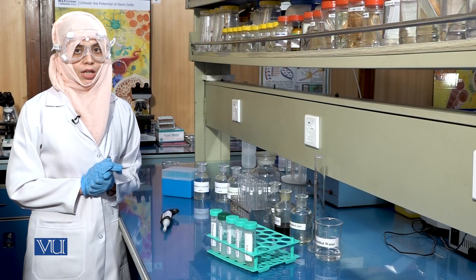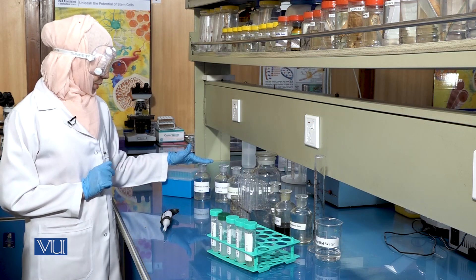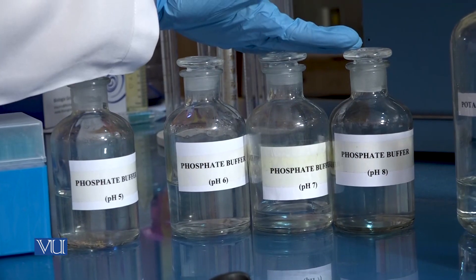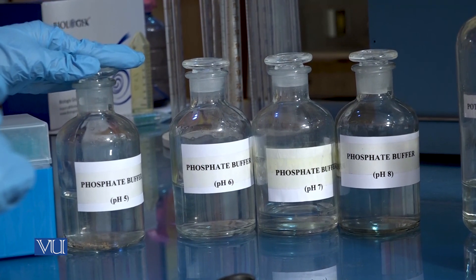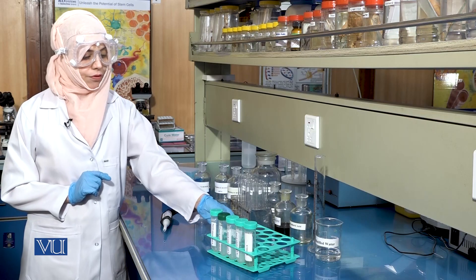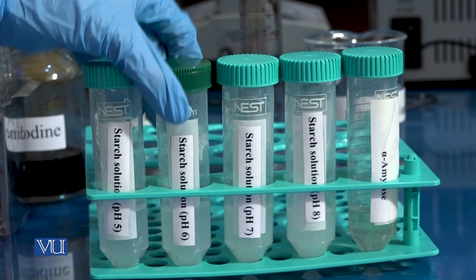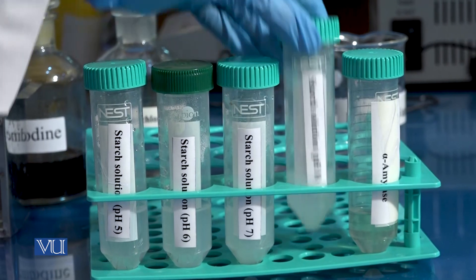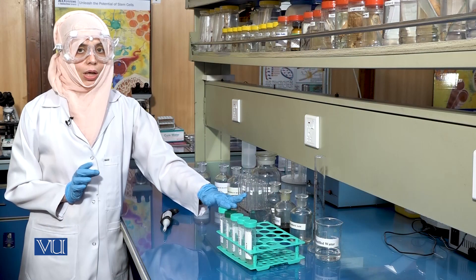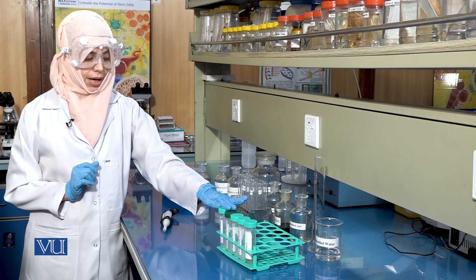To check the effect of pH on the activity of alpha amylase, we will be using buffers of four different pH: pH 5, pH 6, pH 7 and pH 8. This time we will prepare 1% starch solution in each of these buffers, so that at the end we will have starch solution of pH 5, pH 6, pH 7 and pH 8. We will simply repeat the steps carried out to check the effect of substrate concentration on enzyme activity.